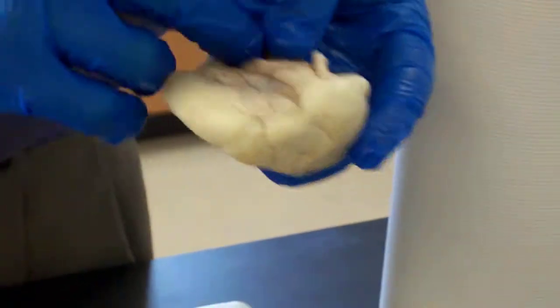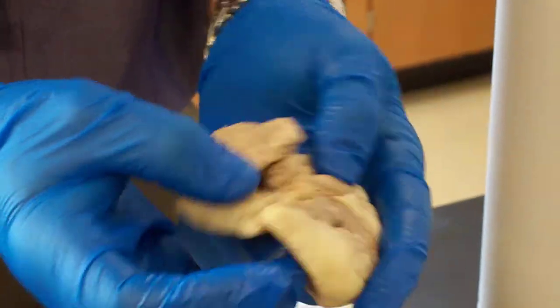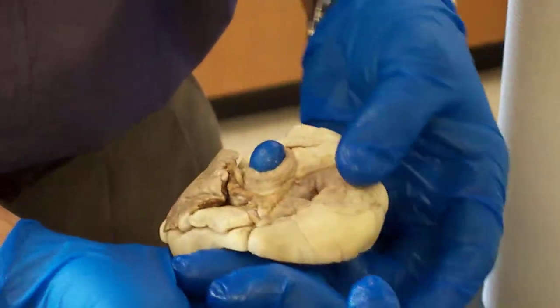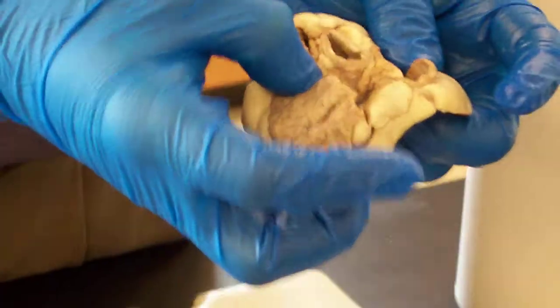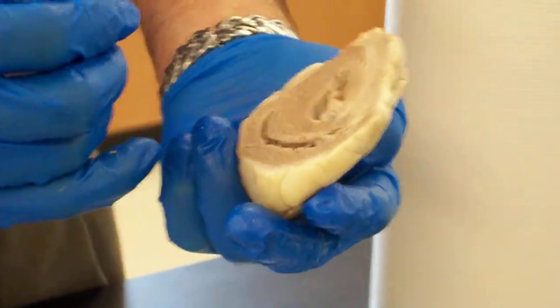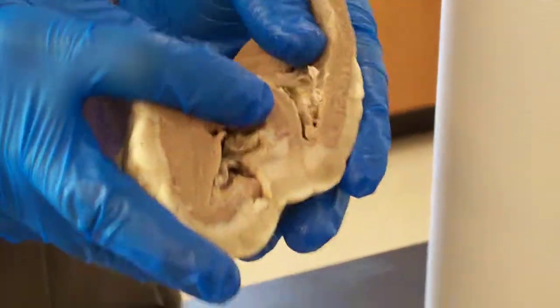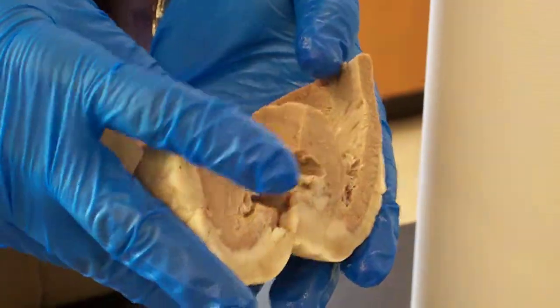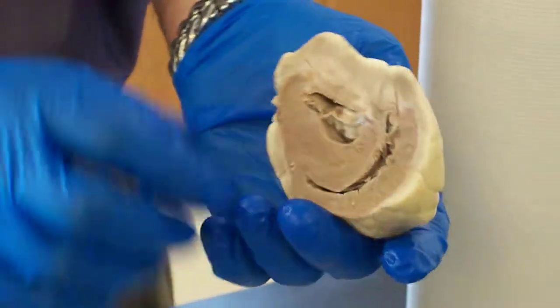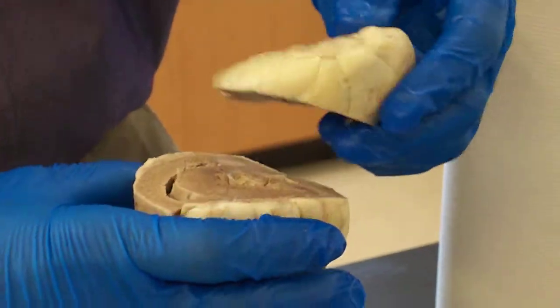This is the inferior vena cava. This has to be the aortic semilunar valve — it comes out of the top. It's a large one — aortic semilunar valve. The pulmonary semilunar valve and aortic semilunar valve are going to be off the top of the heart here.